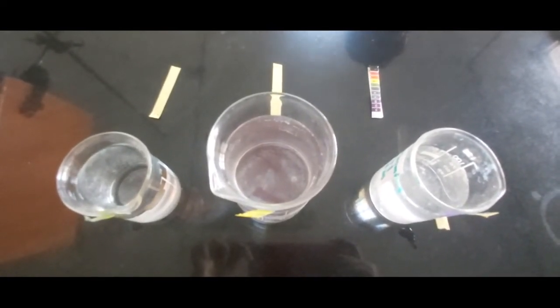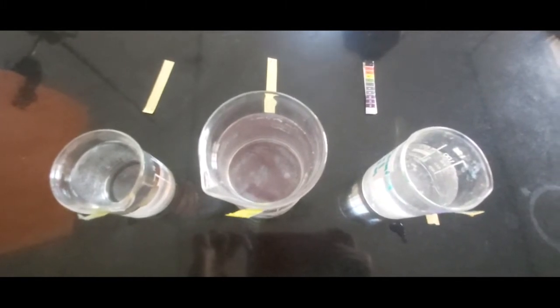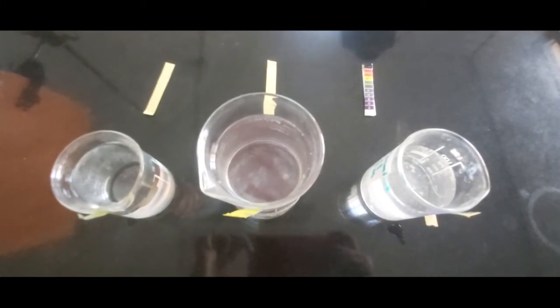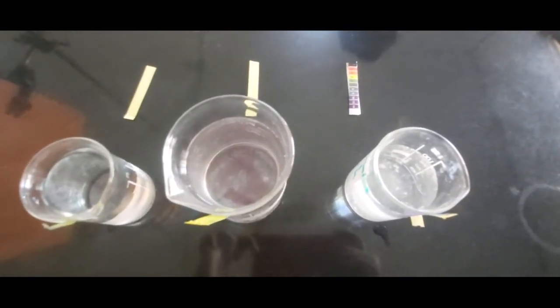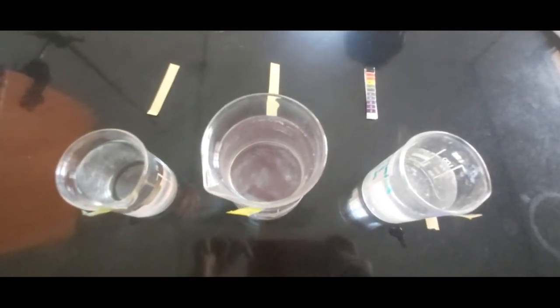The observations for the water samples for their respective pH values — we can prepare an observation table consisting of the different water samples. The first is distilled water: pH 7, nature is neutral. The second is tap water: slightly basic or slightly acidic depending upon the student's readings. The third is swimming pool water: the pH reading in today's practical is 12, and the nature of water is basic.